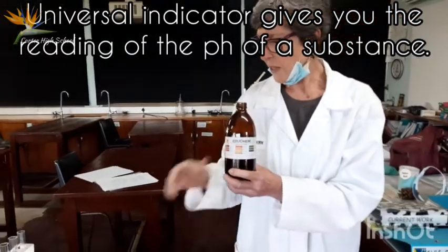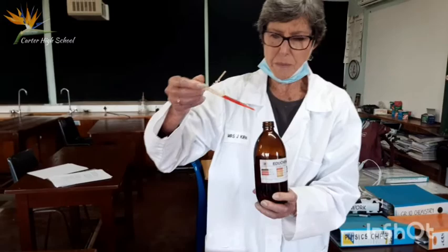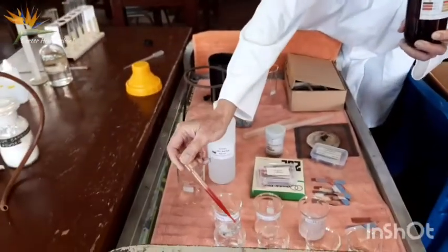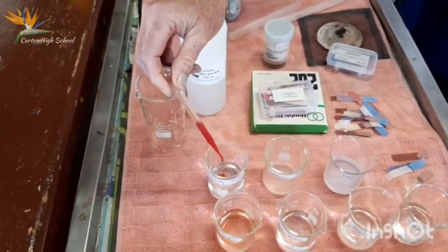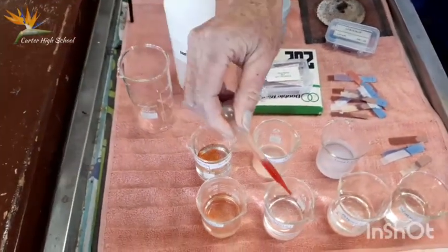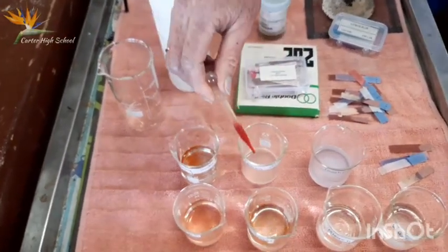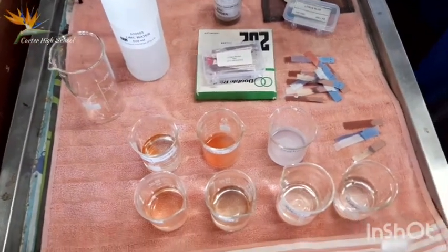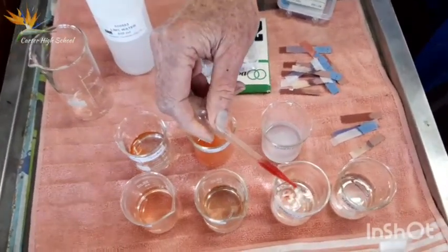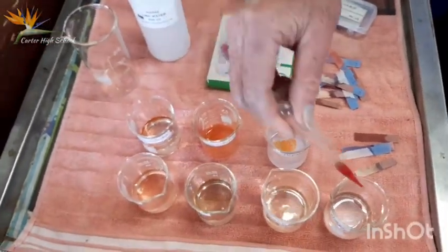So we're going to look at those same substances now and get an idea of what their pH was. I'm going to take a little bit and put it into each of these. There's our vinegar, and I'll go back to these in a second. You see there, it's going blue. That's the washing soda, isn't it? Washing soda. Right. I'll show you each of these individually, and we're going to read the pH values. Usually only need about 2 or 3 drops in each of them. That should actually turn darker than it is.